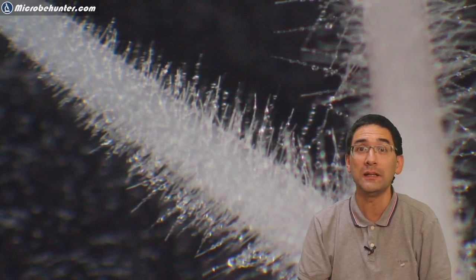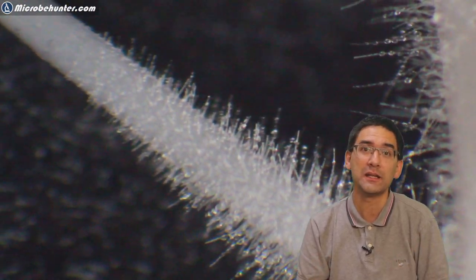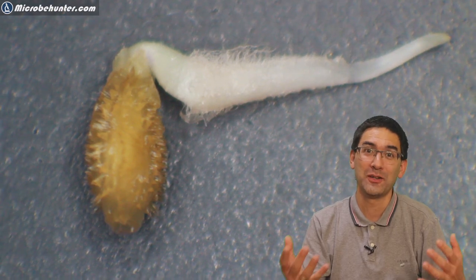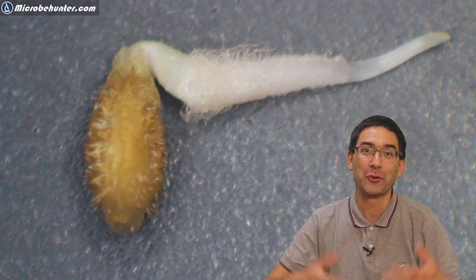I wanted to observe the growth of these roots under the microscope. I zoomed in quite a bit and I waited several minutes, around 25 minutes. I simply turned on the camera and recorded the growth of the root, barely visible if you just sit next to it, but on the time lapse it was possible to observe the root growth. Of course you have to take care that there is always enough water, because during this time the water evaporates.